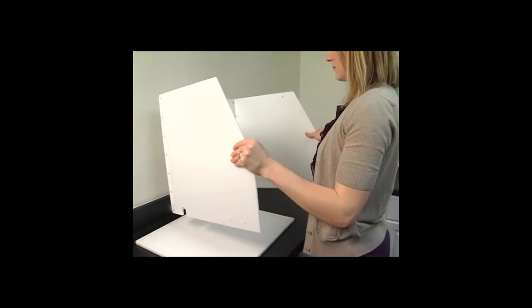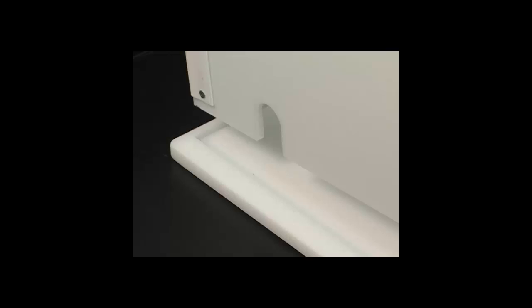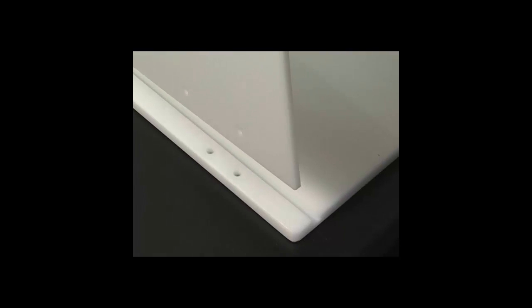Place the side and back panels into the base of the hood. Please note, you will need to inverse these panels in order to properly fit into the grooves of the base panel. Failure to do so will result in the panels not fitting properly.